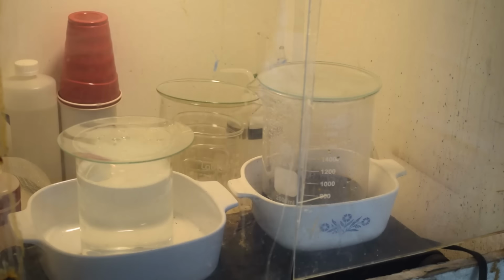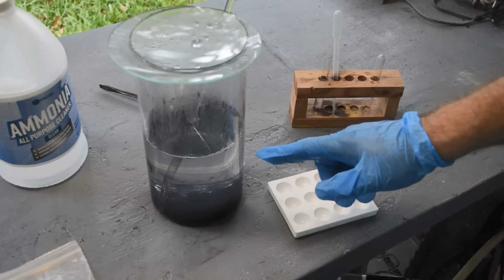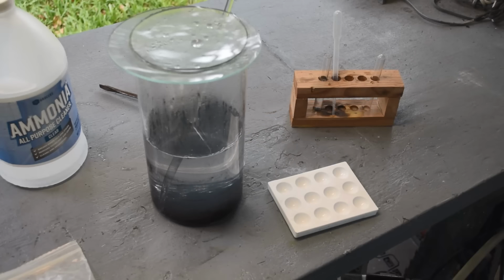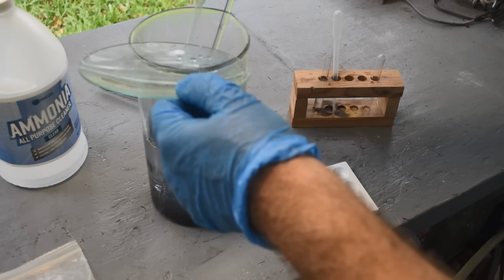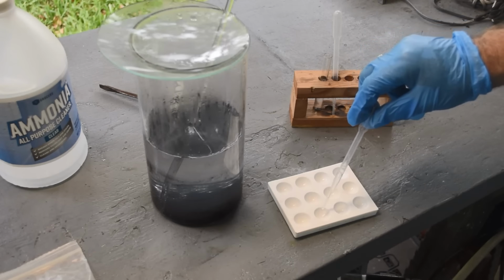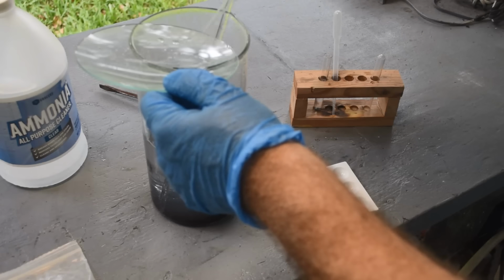All right, we're back and we're ready to go. While we're waiting on that stuff to heat up in the fume hood, I thought we'd do a stannous chloride test on this liquid here. Based on the color, I'm not expecting to find much in it, but we'll give it a shot and just see in case. Maybe there's going to be a little gold. Maybe still some palladium in solution. I don't know. We'll see.